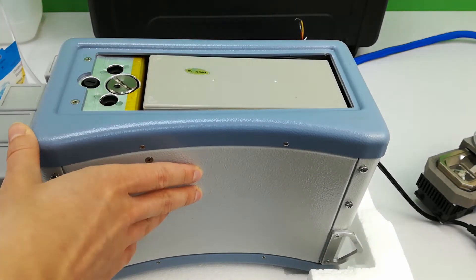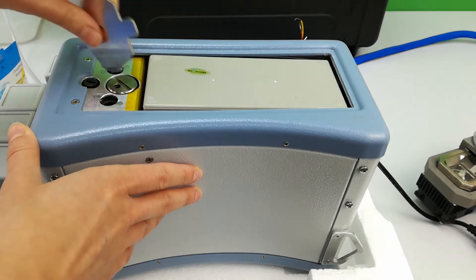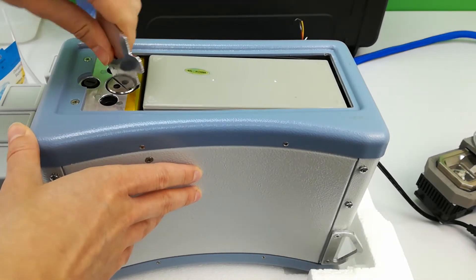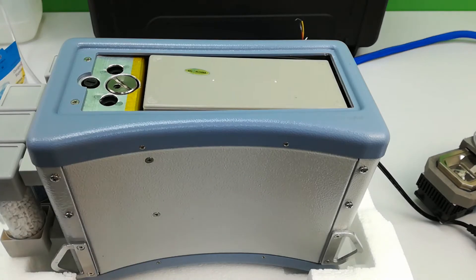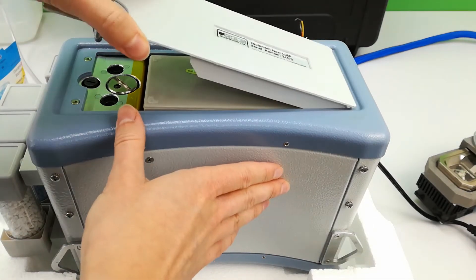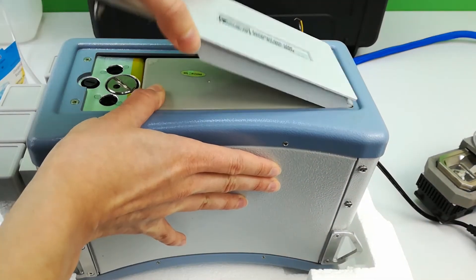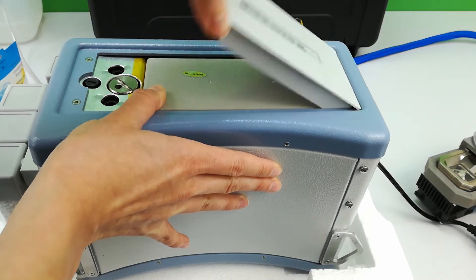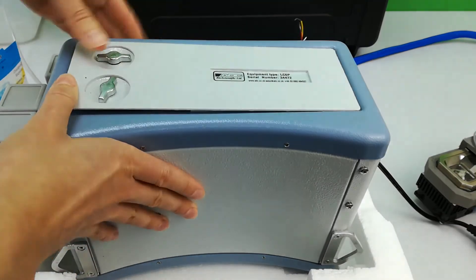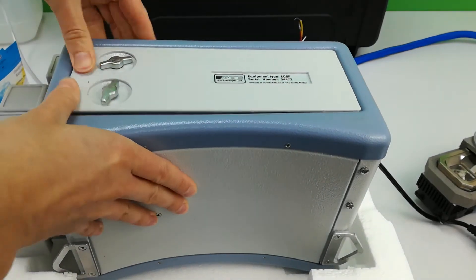As the fresh cartridge is punctured inside the console, you should hear a sharp, short hissing sound. Check that the cartridge is fully tightened and then replace the battery compartment cover.